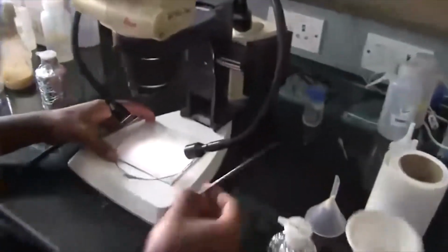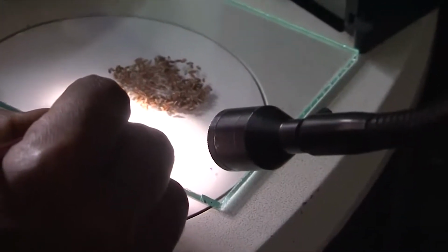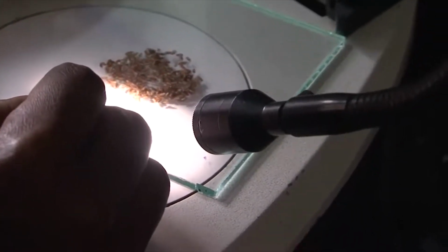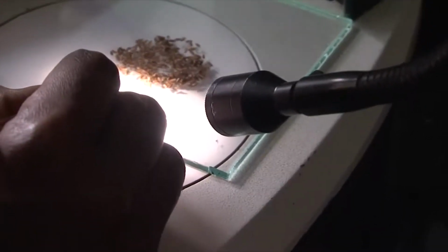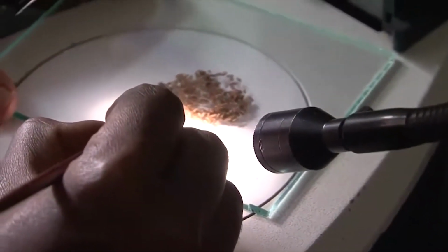Now these are anesthetized flies kept here, and you can watch them under the microscope very clearly. This is a female fly. Usually the female fly is characterized by a bigger abdomen, and the overall size would be bigger when compared to a male fly, which is on the left hand side. There are some body markers which we usually use to differentiate male and female, and this is a normal wild type fly which has red eyes.